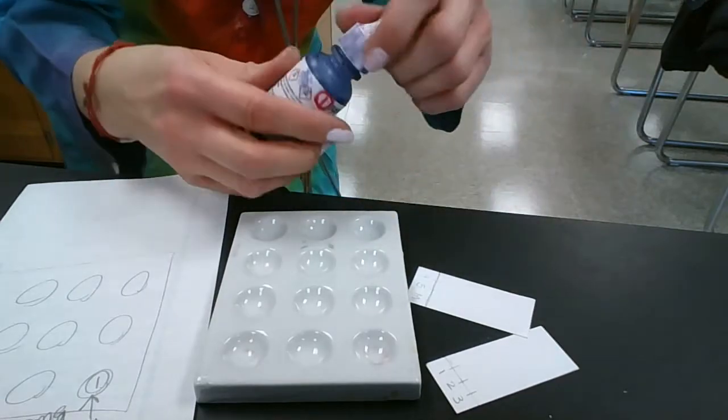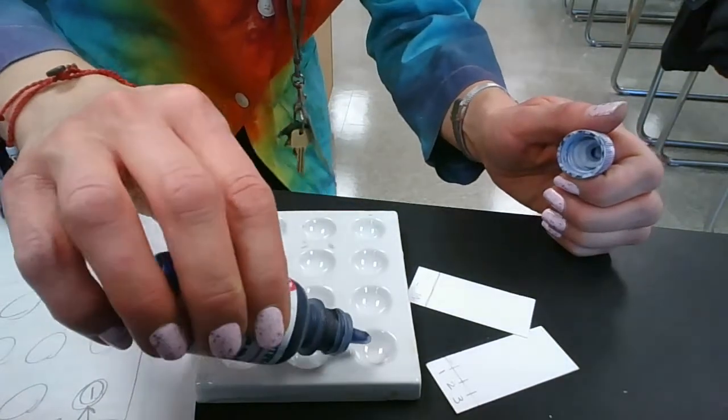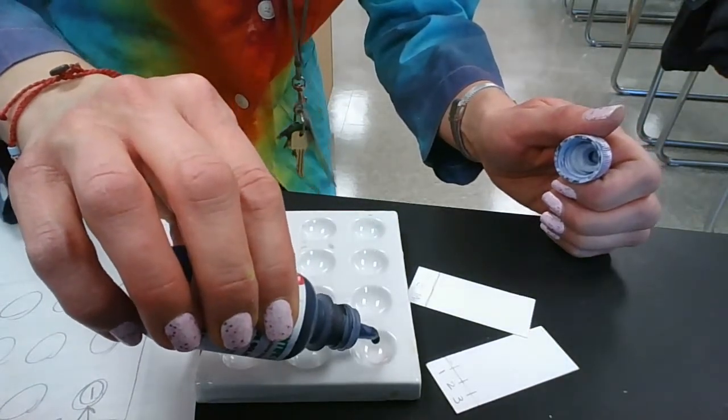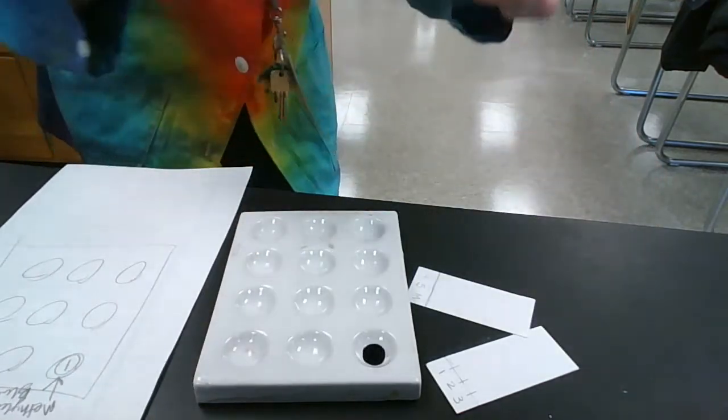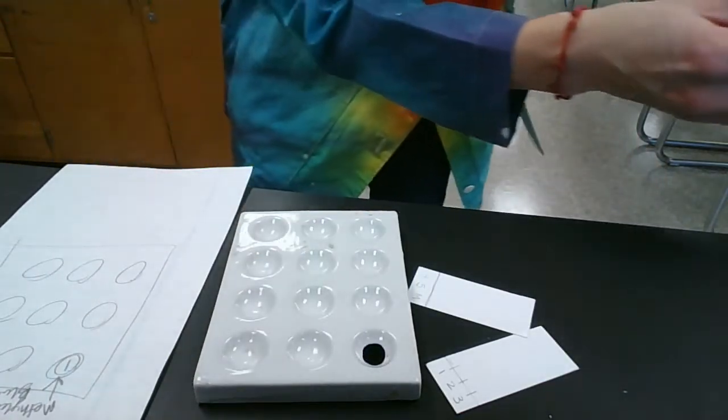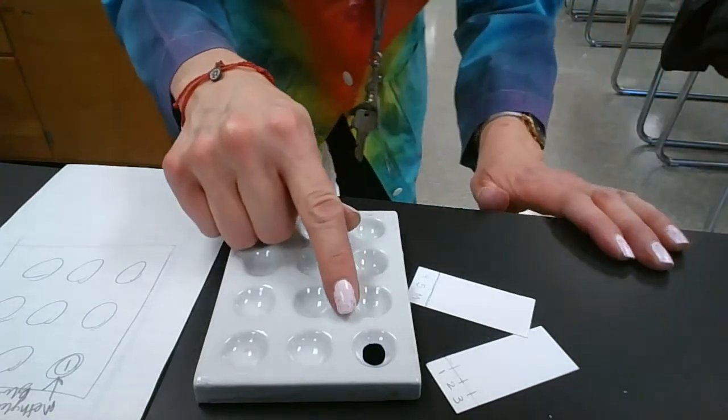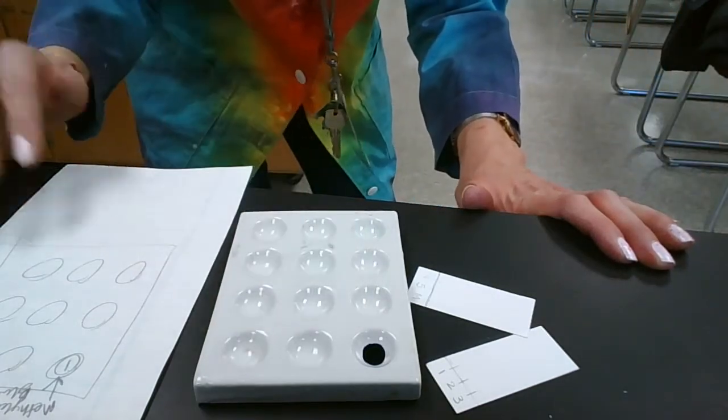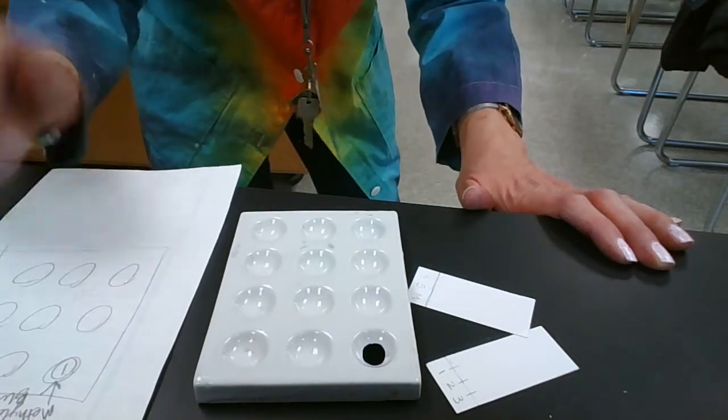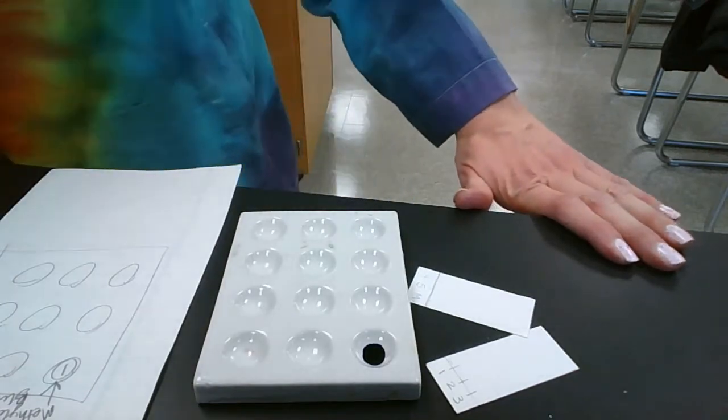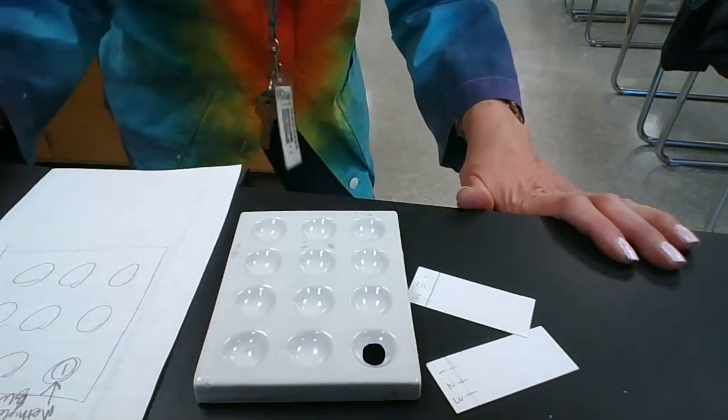There's a central table where you'll find these bottles. Just be very careful to put them back in the same spot so no one else gets mixed up later. You can put all of your six compounds that you're going to study on your plate right away and label it, but for the sake of time I'm just going to show you one, methylene blue.